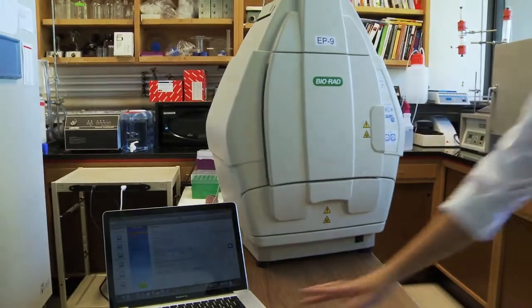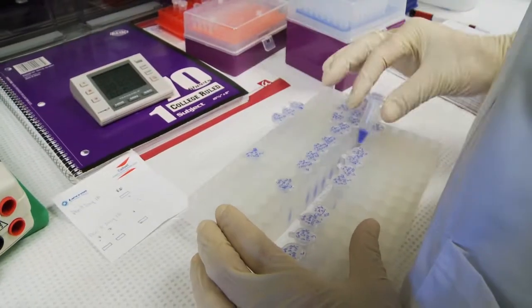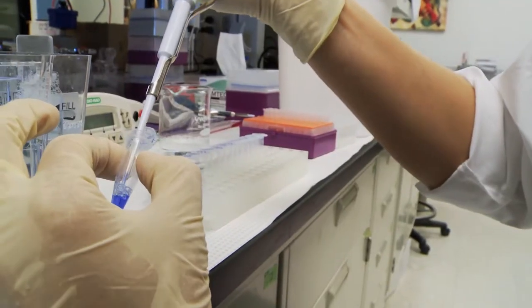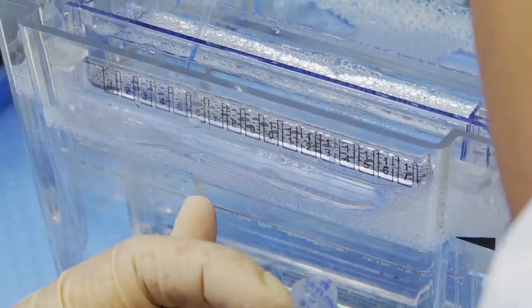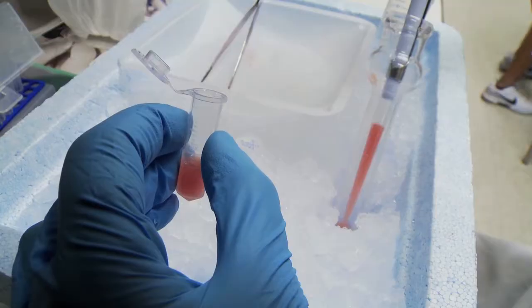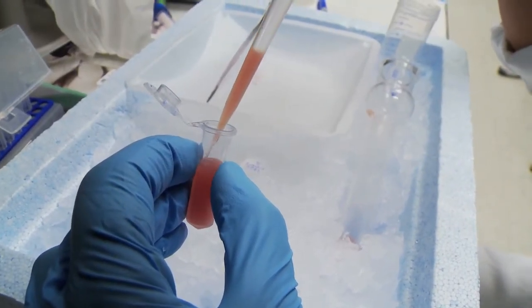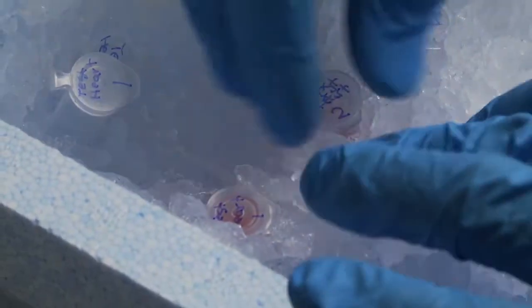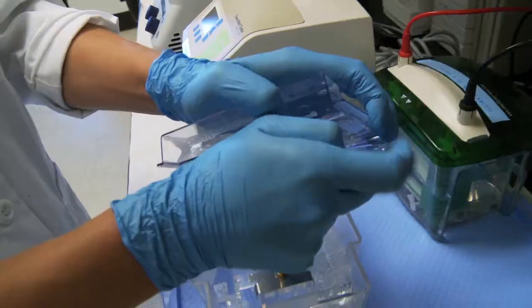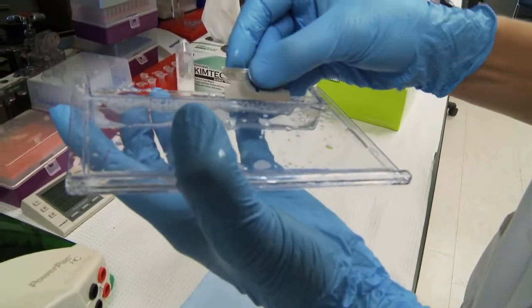Imaging comes into play in our workflow at multiple steps. You have to rely on your imaging to tell the true story of how much antibody is really present for your control versus your experimental animals. It's also really important that before I can do anything with my samples, I have to know that I have the same amount of protein in all of them. The gold standard for checking that is to run an SDS-PAGE gel, and you have to image it.